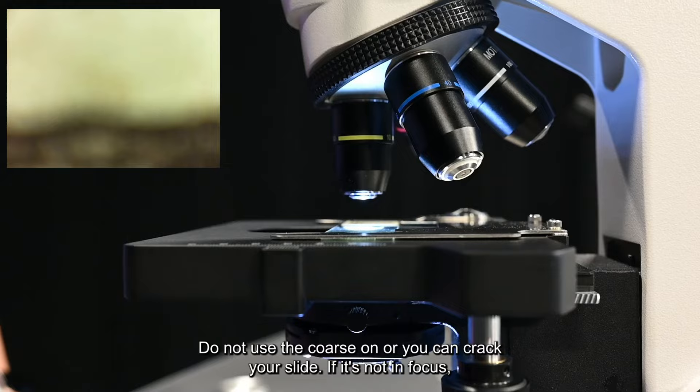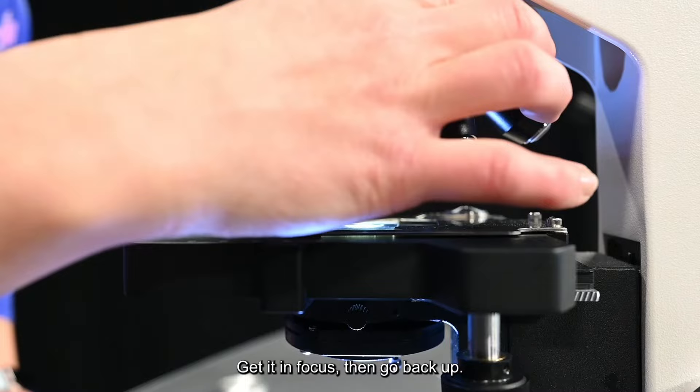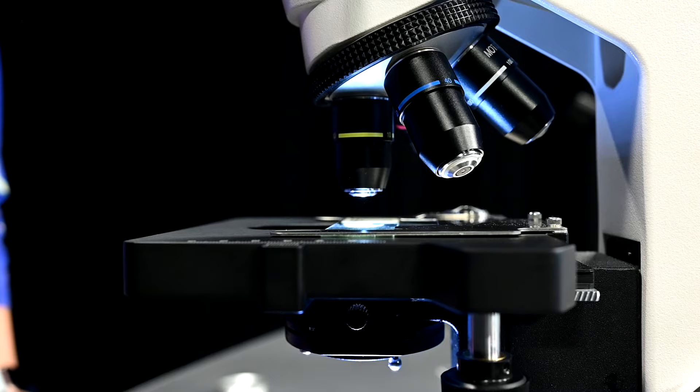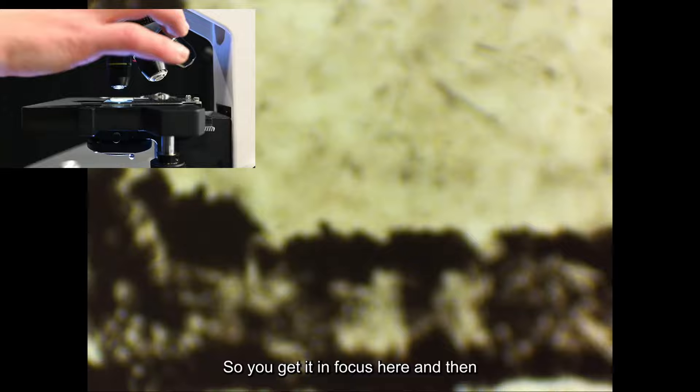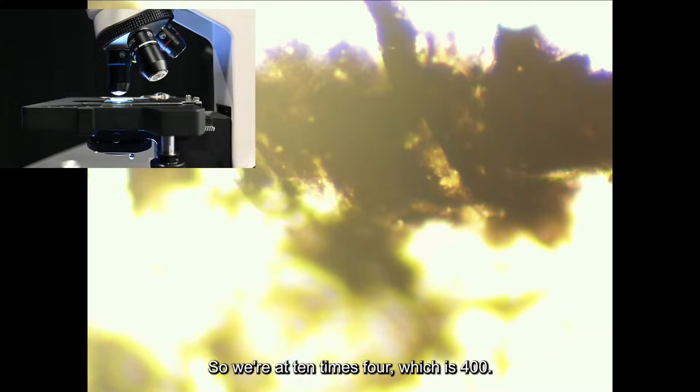I'm only going to use the fine adjustment. Do not use the coarse one or you can crack your slide. If it's not in focus, bump it back down, get it in focus, then go back up. If you're looking up close at nothing and then you magnify more, it's still more nothing.